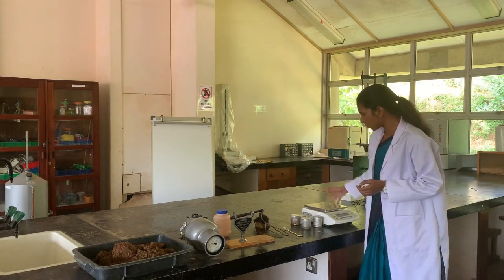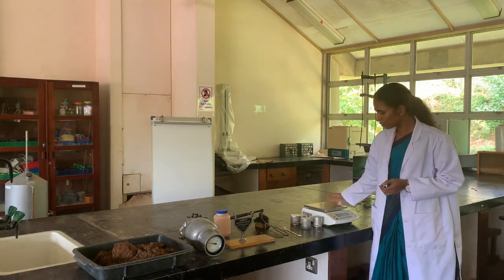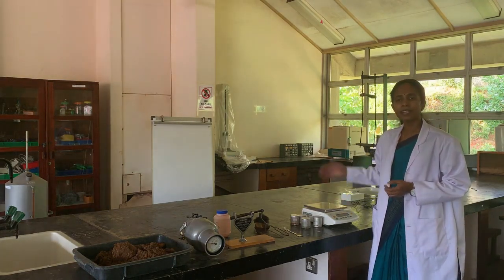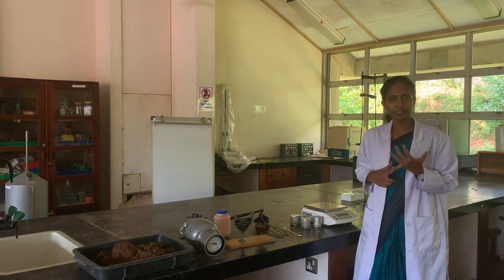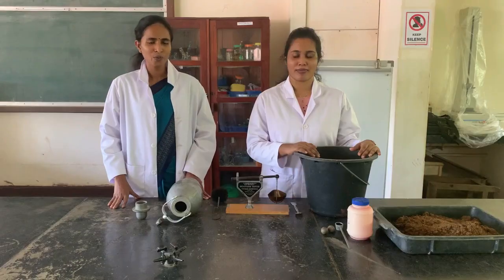In order to validate with the gravimetric method, we are using moisture cans and an analytical balance. In addition to this, we need a drying oven as well as a desiccator.